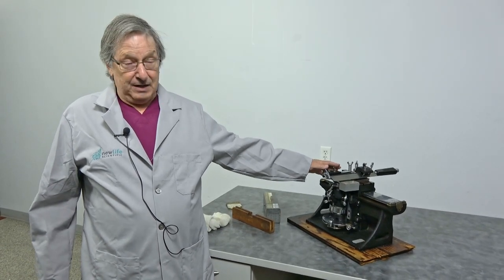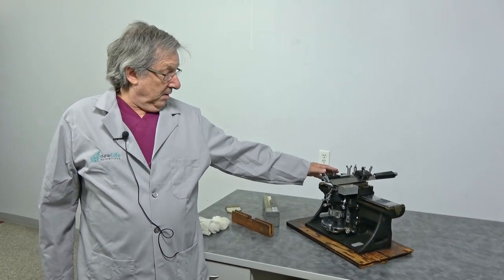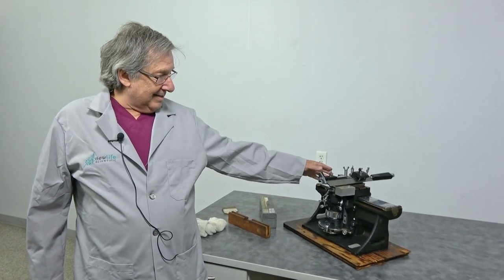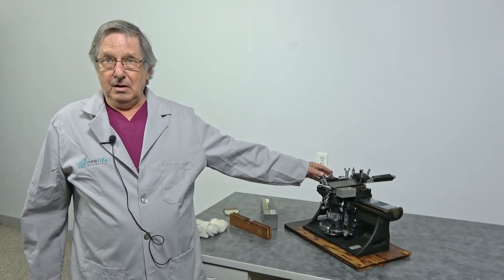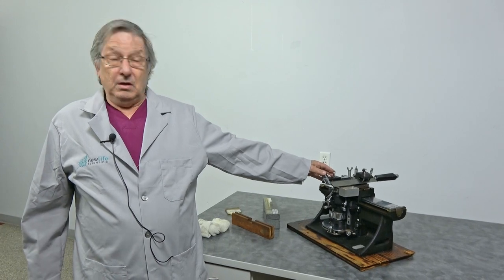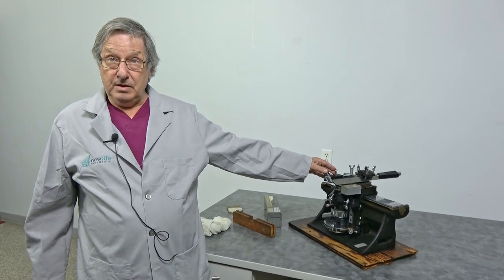This design goes back to pre-1938. We're guessing this was made in the 50s, maybe right after the war, the 40s, late 40s into the 50s.